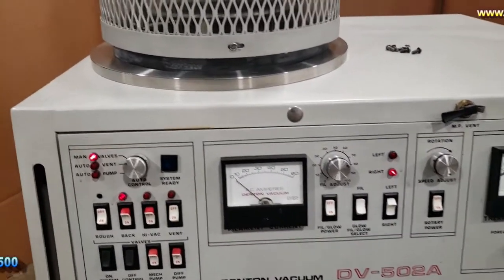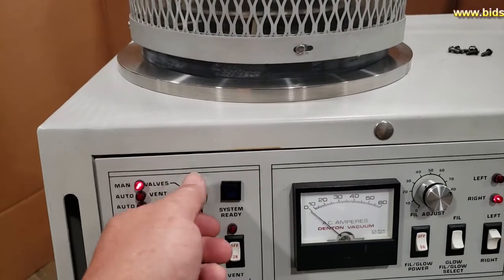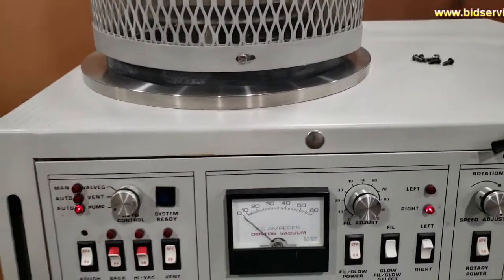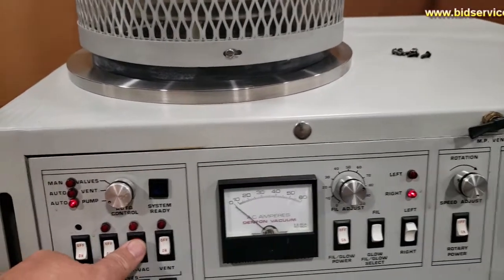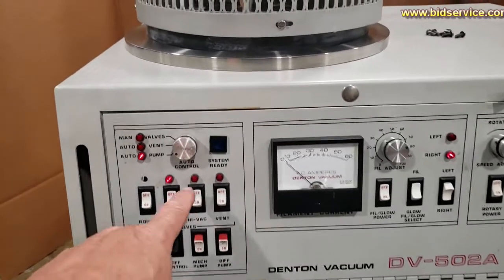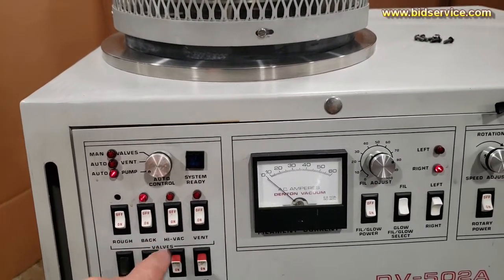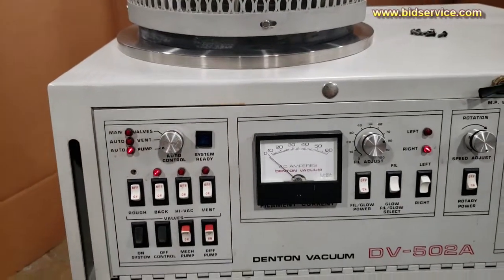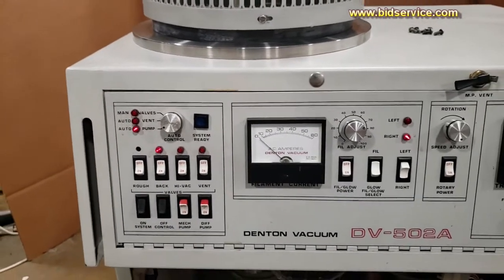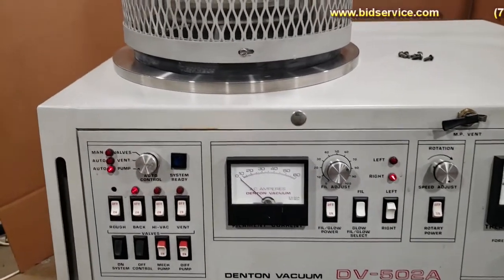Now, to vent the system, all you have to do - I have these all on manual. If I want, I can just go ahead and put this right to pump. What that will do is make these manual controls unnecessary. Unfortunately, I don't have a light for your HiVac and your roughing, and that's on order. It will be fully functional - the lights will be replaced with something working and the system ready light will be on by the time this is ready to be shipped out.